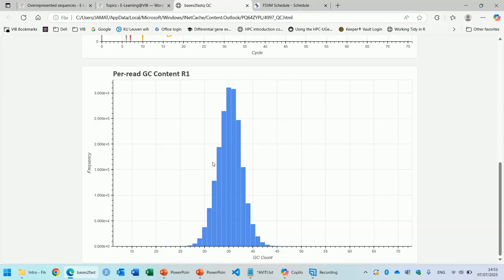In a diverse and random library, you should see a smooth, symmetrical, and bell-shaped distribution. If you spot a big spike in this plot, that's a red flag. It usually means that there is one single sequence that occurs many times in the file, which skews the distribution. And then the GC content of that particular sequence creates the spike in the plot. So also here, you will see if there's a contaminating sequence in your FASTQ file.